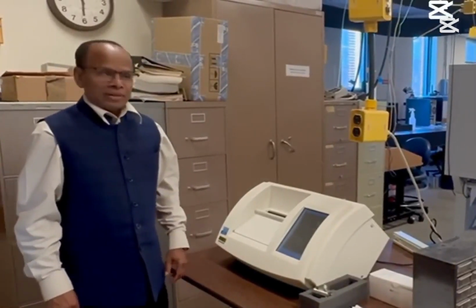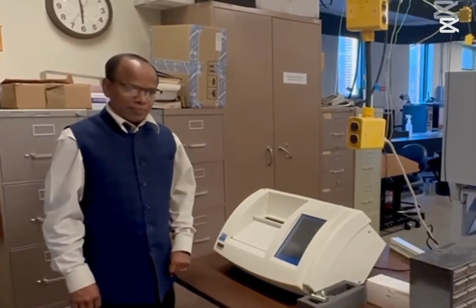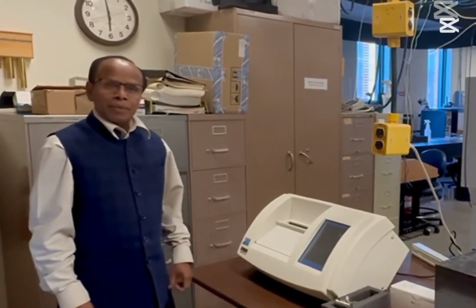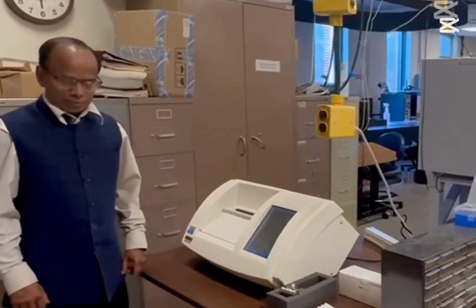Welcome to the training of the polarimeter. In this session, I will tell you different steps of polarimeter use: sample preparation, measurement, analysis, and troubleshooting.